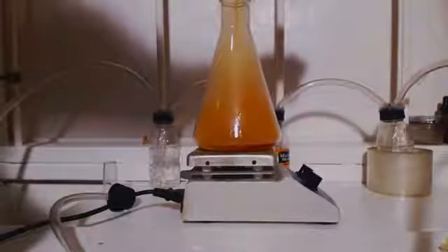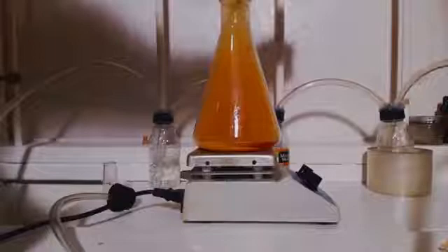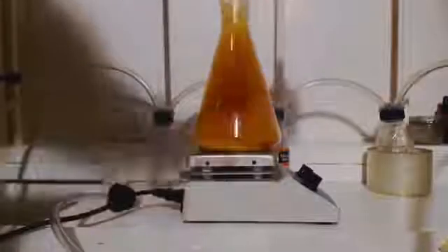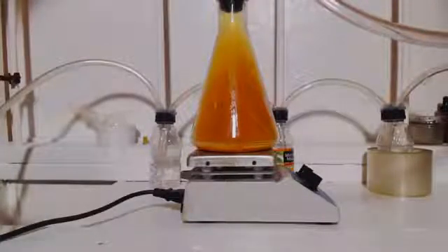100 milliliter flask, so I'm guessing it's about 62, 63 milliliters. It's already heating up. You can see it's already starting to get to the white. You can see all that silver nitrate.